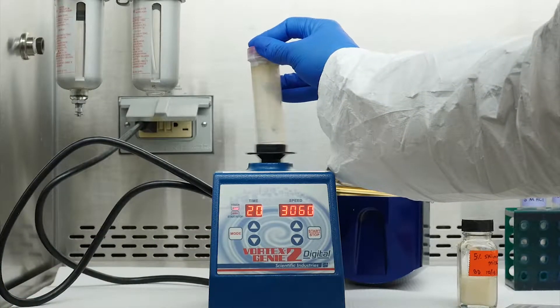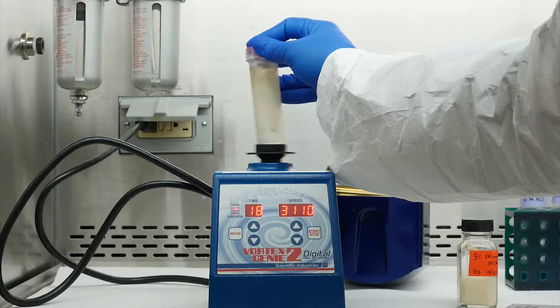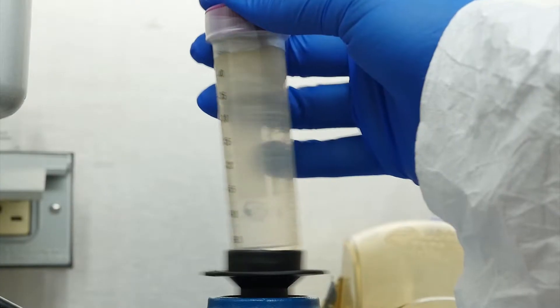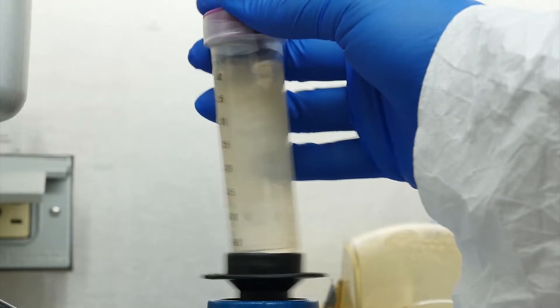This video introduces the BMFS elution and secondary concentration laboratory protocols. However, first, we have a few reminders.